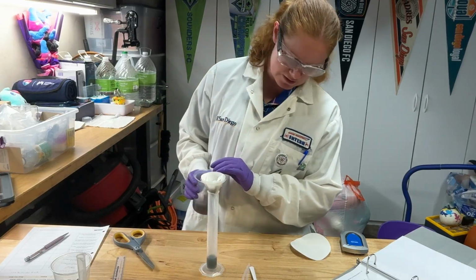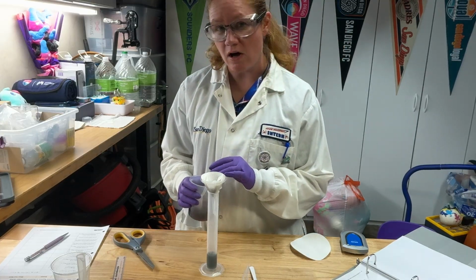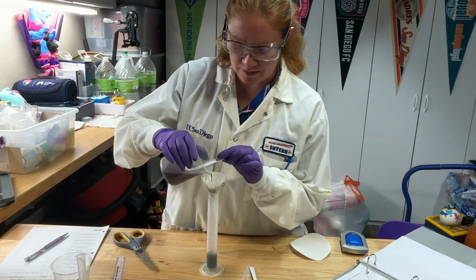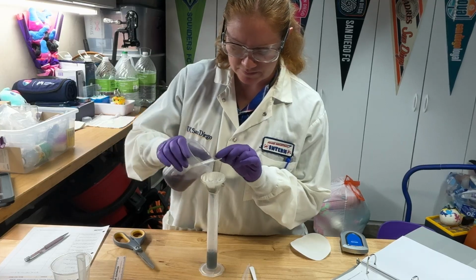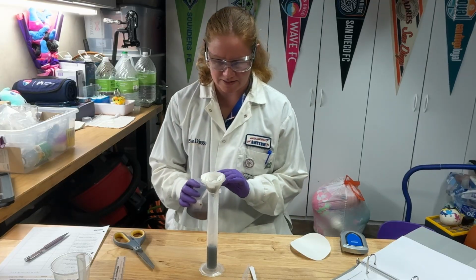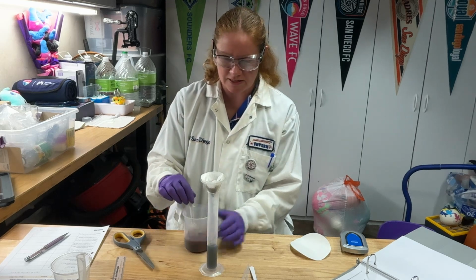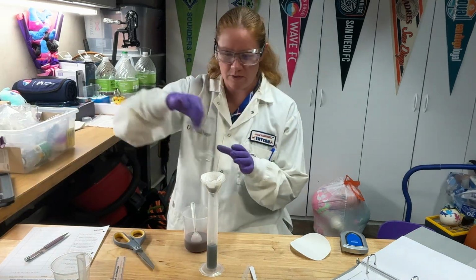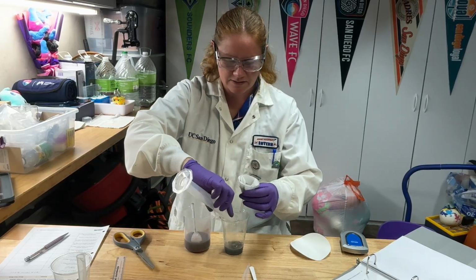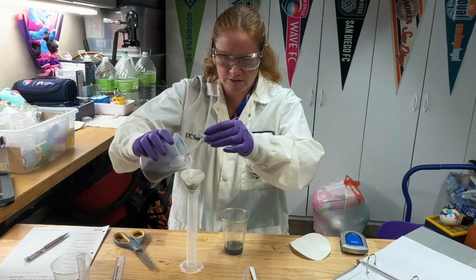As you're filtering, mine looks like there might be a little bit of blue left, which means probably not all the copper came out of solution, which is going to lead me to believe that more than likely my aluminum would have been my limiting reagent. But I also didn't let mine settle. I'm trying to go a little quicker so I can get to the next step for you all. This is going to have more volume of solution than the graduated cylinder is going to hold, so with that waste container I set up a minute ago, I can periodically stop and pour some of my filtrate out.